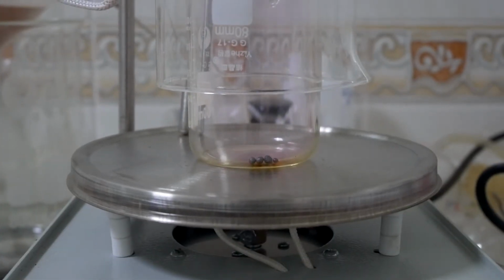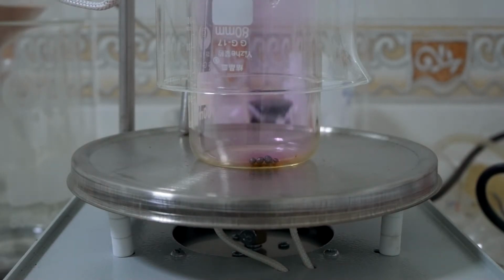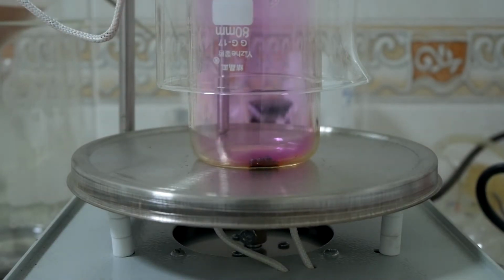The iodine grains are fuming. Make sure to put a beaker full of cold water on top so that the vapor can condense and form small crystals. Wear a respirator when doing this experiment, because the vapor is quite toxic.